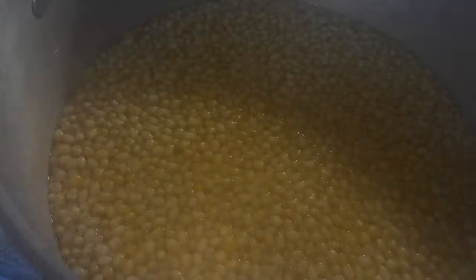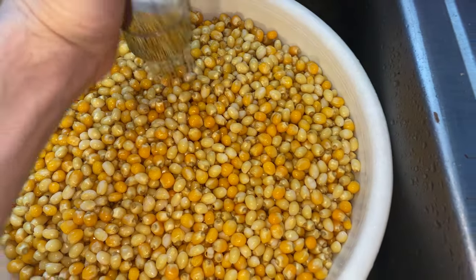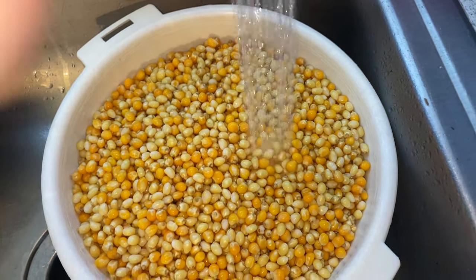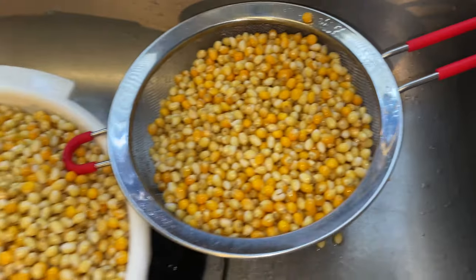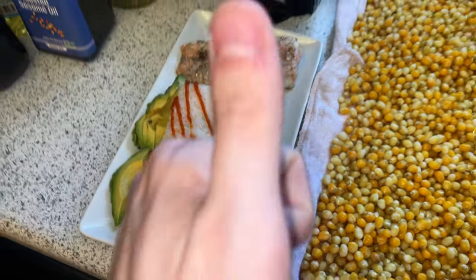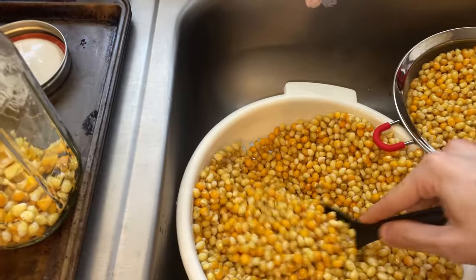Once it's done, go ahead and cool your popcorn. This will make sure that you don't overcook the grain — if it's overcooked it's not the end of the world, but you might experience higher contamination rates. I always make sure to move the grain around as I'm cooling it as well. Since this is a lot of popcorn, I lay it across two sheet pans and two strainers. After about 25 minutes you're all good to load them up into jars. When loading into the jars, make sure to leave a little bit of room at the top so you can do a break and shake later on.